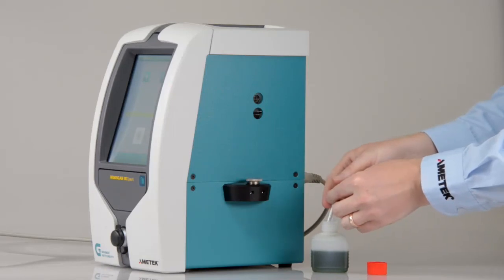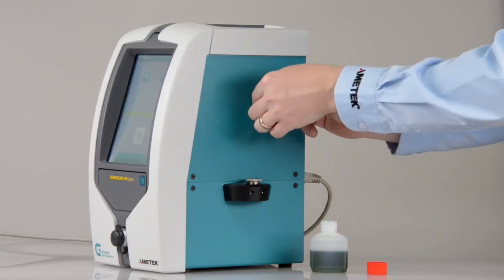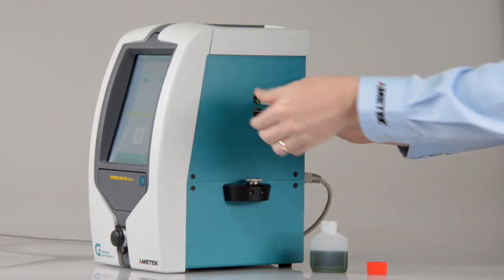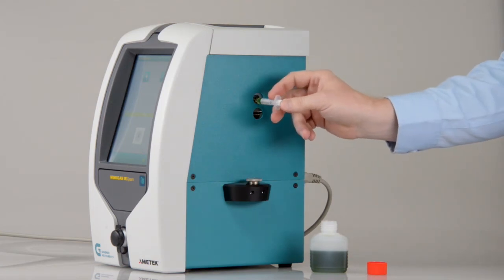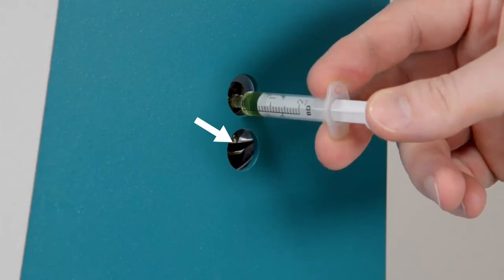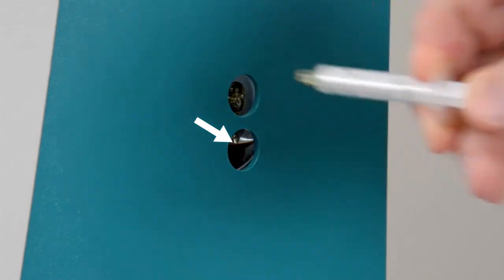Check the oil level from time to time when the instrument is in idle mode. If the oil level is below the inner rim, refill 0.5 ml of oil.